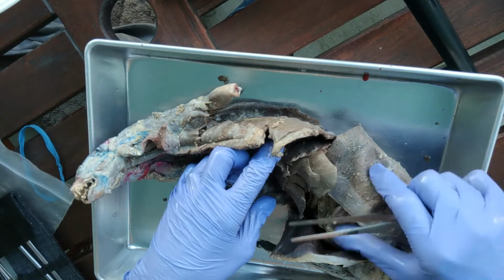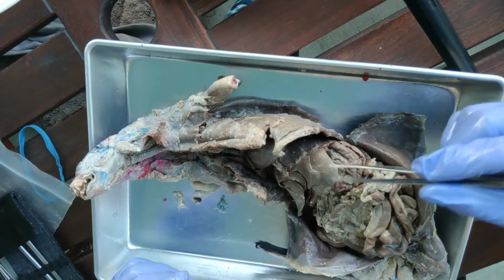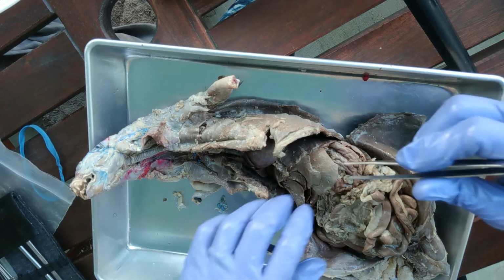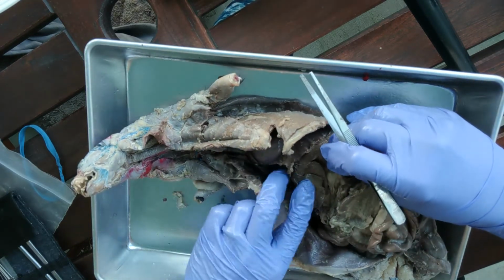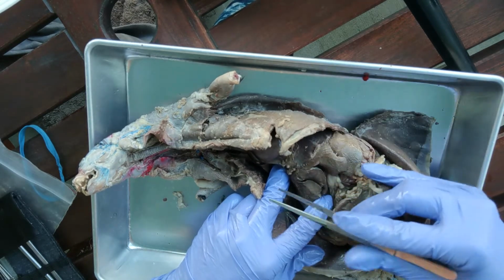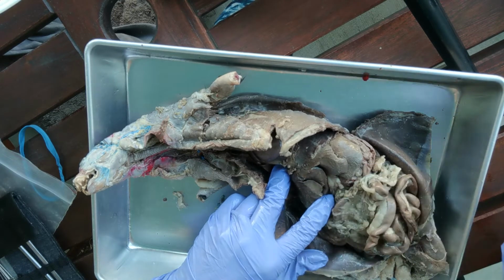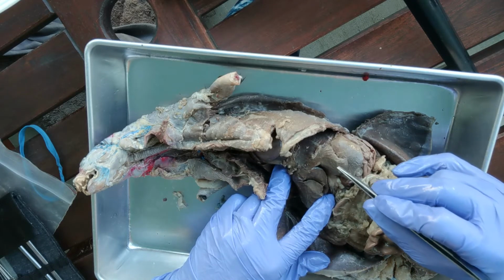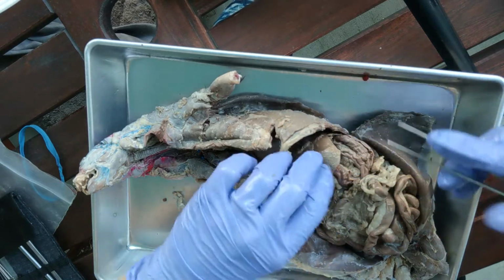Underneath the diaphragm is the liver. The liver is an important organ for the digestive system. It creates bile. It also filters your blood to keep it nice and clean, and stores excess glucose, which is sugar. Okay. Kind of embedded between the lobes of the liver is a little gallbladder. This little pouch right here is the gallbladder, and the function of the gallbladder is to store the bile that the liver makes. Okay, so let's put that up here.